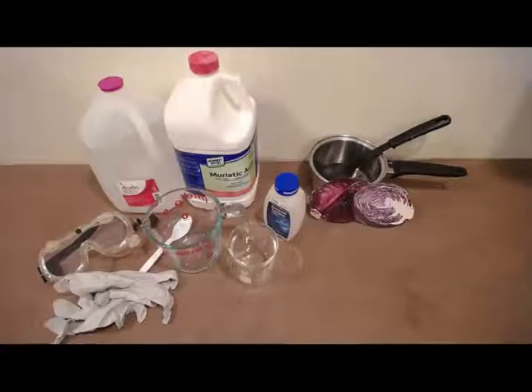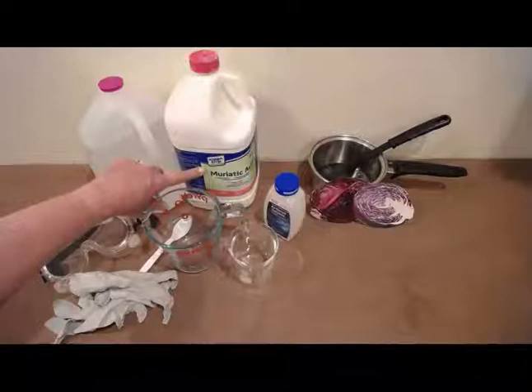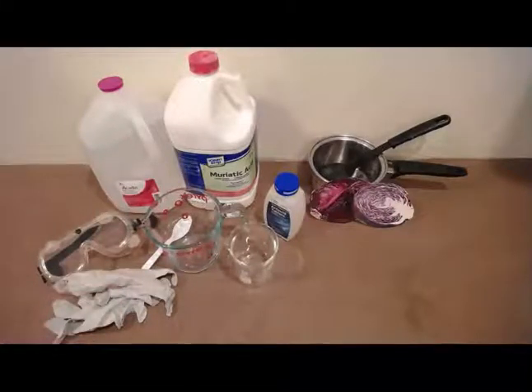Again, you have to be super careful doing that. Muriatic acid is extremely caustic. It will burn your skin. It will burn your respiratory tract, your eyes. So you want to make sure you're using gloves and safety goggles and other safety precautions, and I highly recommend that you work with an adult who knows what they're doing if you're going to make your own. And again, that's just an alternative to toilet bowl cleaner if you're not able to find the type that is specified in the procedure.